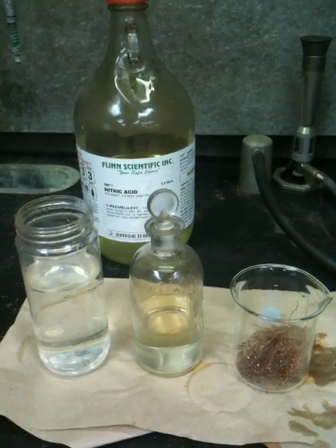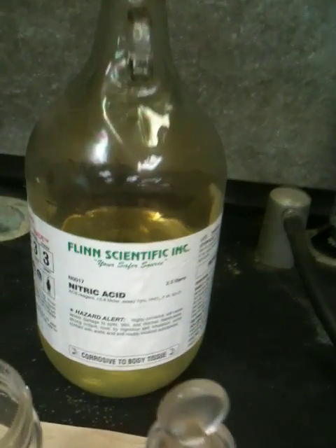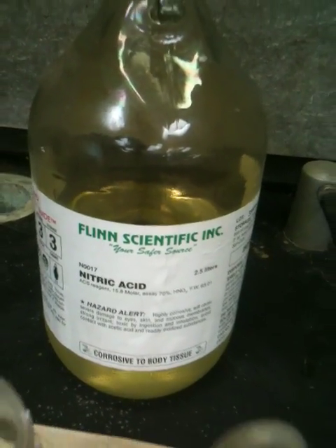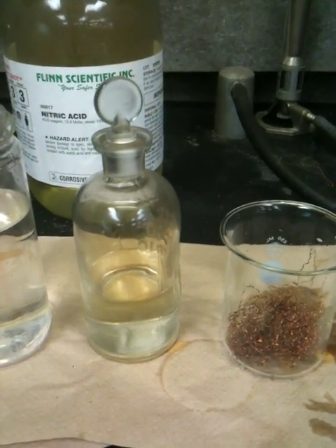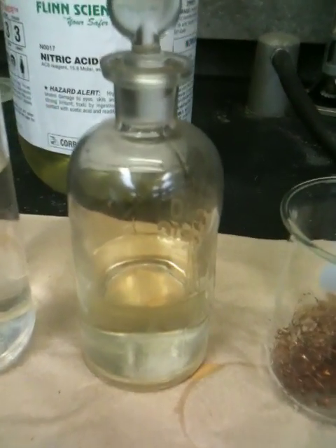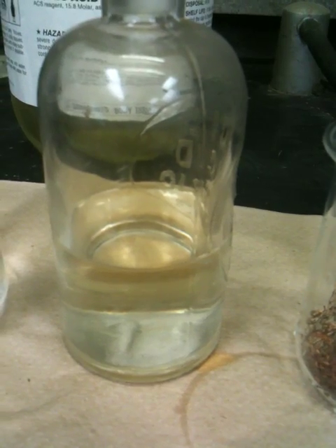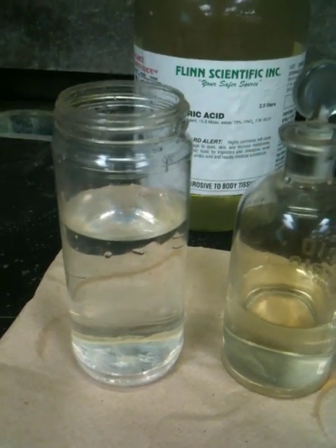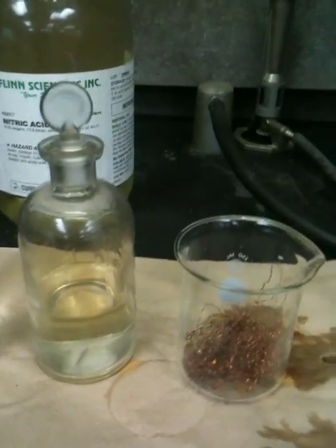We're going to use concentrated nitric acid, which I've put into this little storage bottle to work with more easily — so there's the actual solution I'm going to be using. Over here I just have some plain water, and you'll see how all of this works together in just a moment.